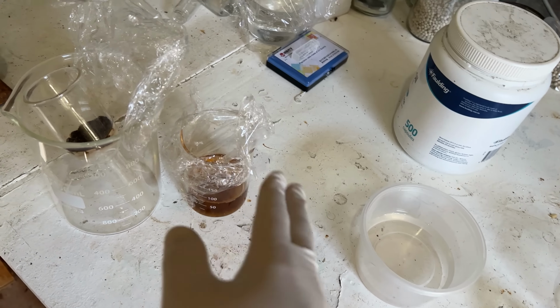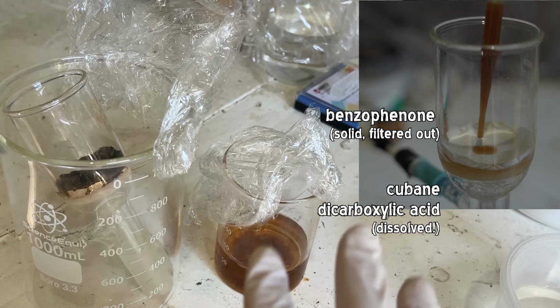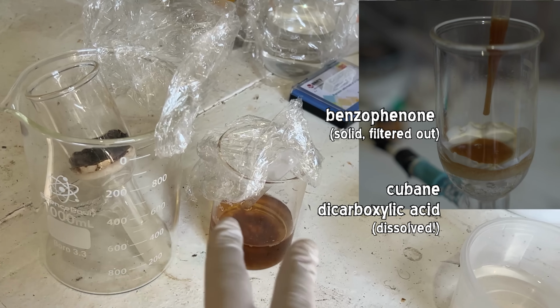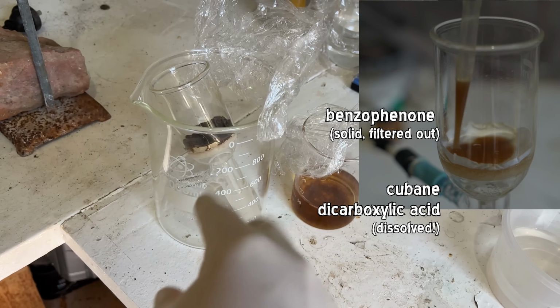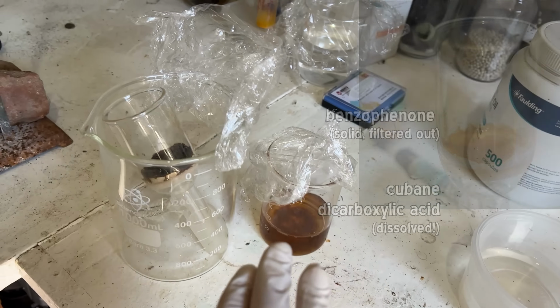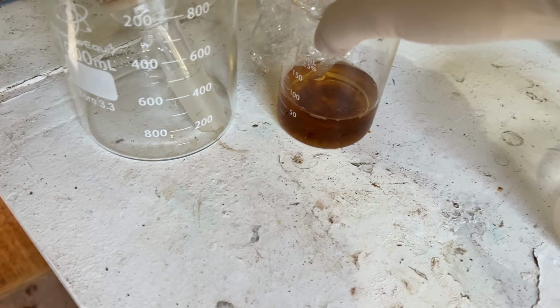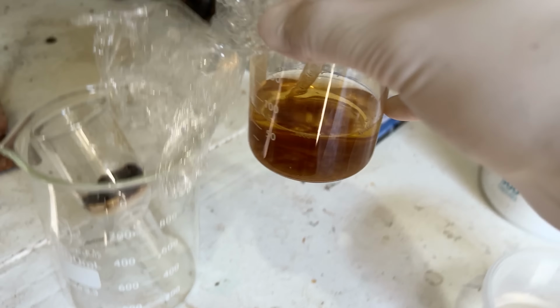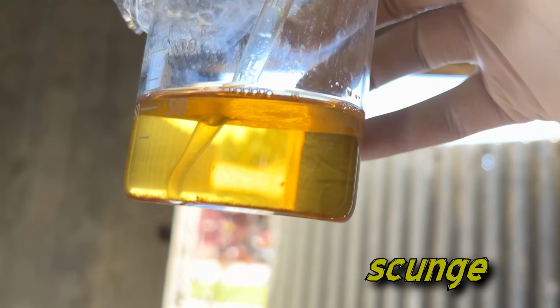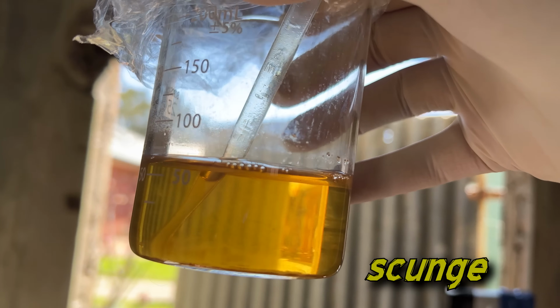So our cubane dicarboxylic acid is still floating around in solution here. It's good not to throw away any solutions immediately, although we are potentially 2 or 3 weeks after we initially did this filtration. So maybe the cubane has all decomposed. It does suck being a very slow person, but what can you do? We'll give this another little filter because there's some absolute crud down at the bottom there, which is probably just more benzophenone that's slowly settled out.